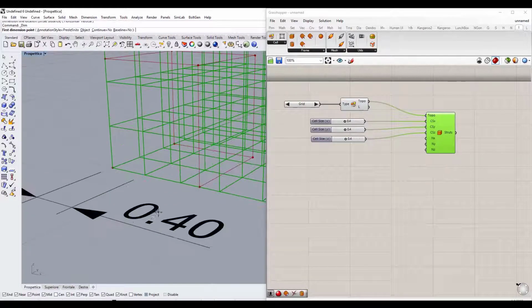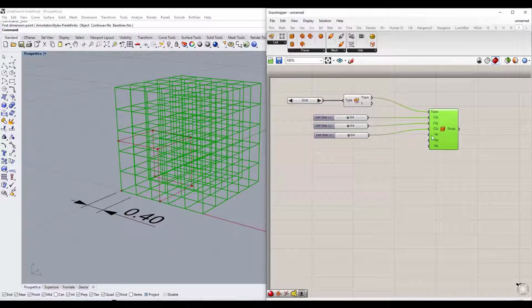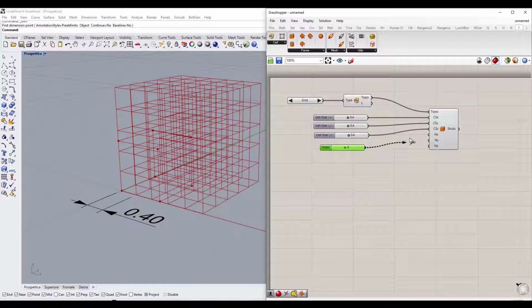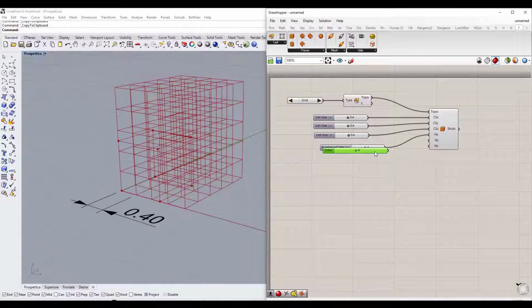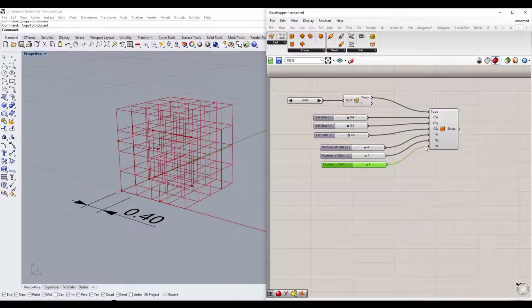But how many times do we want to repeat these cells in the three dimensions of space? We simply assign numeric values to the NX, NY, and NZ entries of the components. We click twice on the main screen and type a number, for example 4, and then click Enter. Then we can connect the slider to the NX item. We have just determined that our scaffold will consist of 4 elementary cells along the X direction of the space, each with a length of 0.4 millimeters. Then we copy and paste the slider twice and connect them under NY and then NZ.